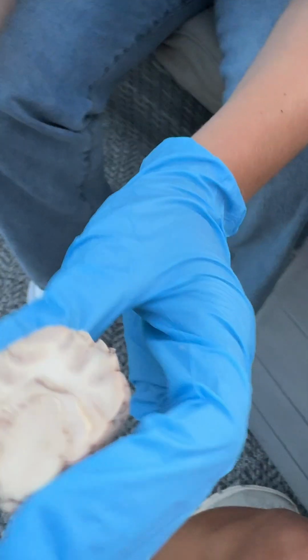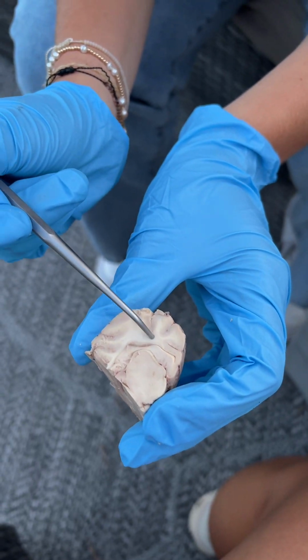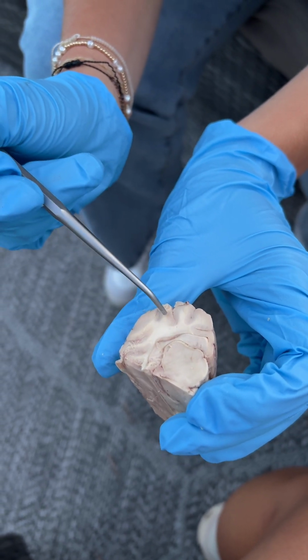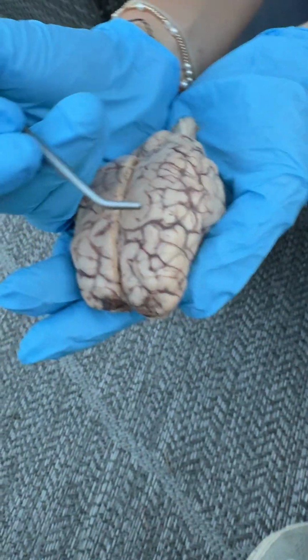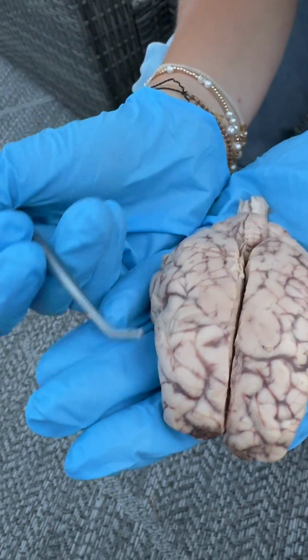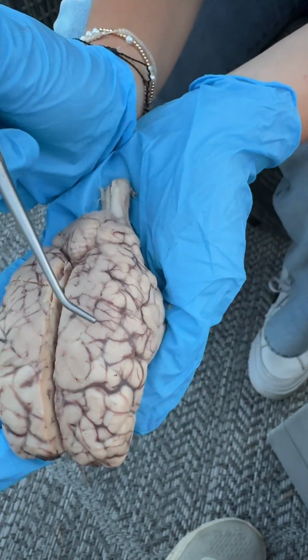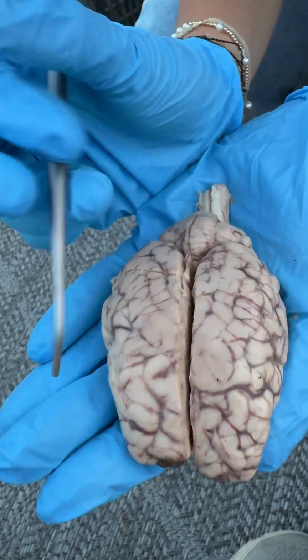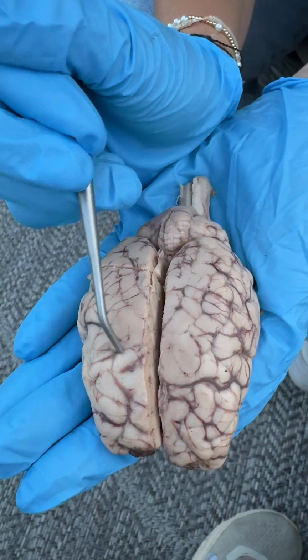Okay, and now we will be going over white matter in here. You see those lines? And then gray matter, where these darker spots are around the white matter. Okay, so the gyri are the parts of the outside of the brain that stick out a little more. If you notice here, these would be the gyri, and then the sulci would be these kind of indents we've got going on here, all along the gyri.